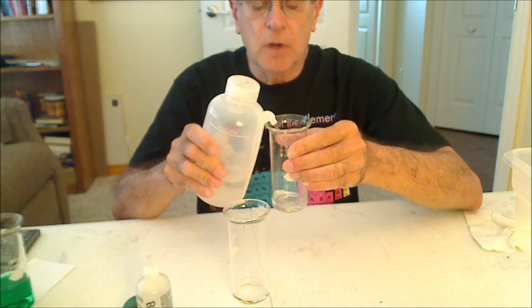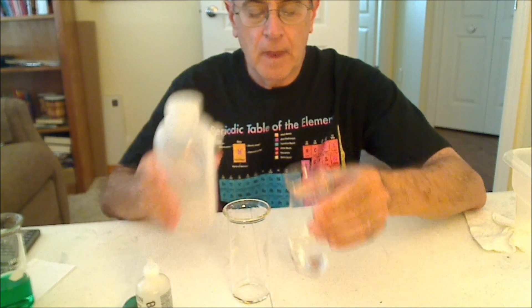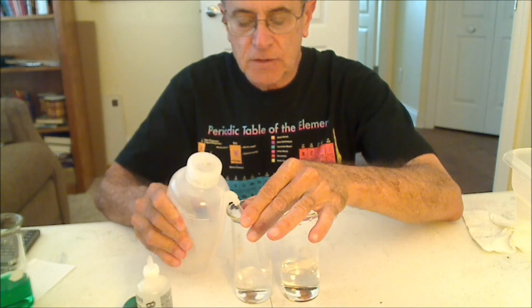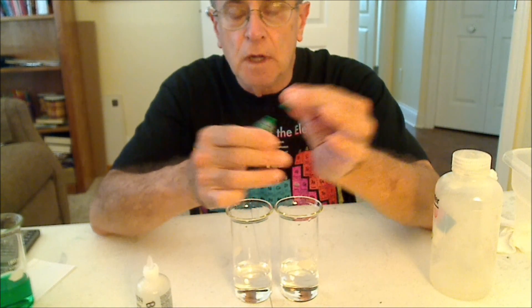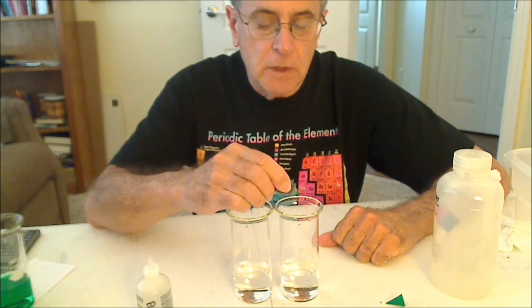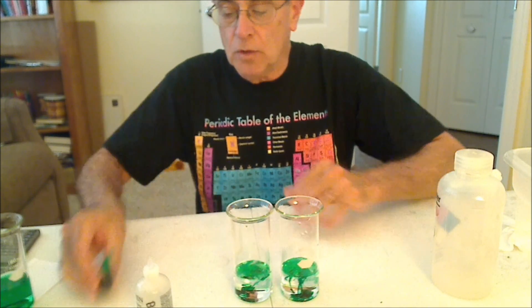I'm going to start by adding some tap water to a beaker, actually to two beakers, and I'm going to add one drop of green food coloring to each of the beakers. One of these, the one on my left, will act as a control.